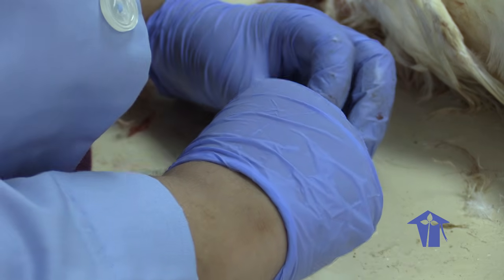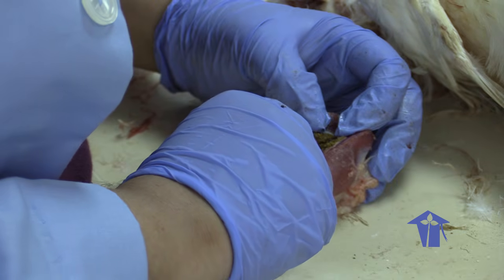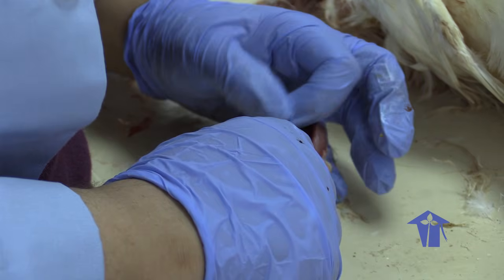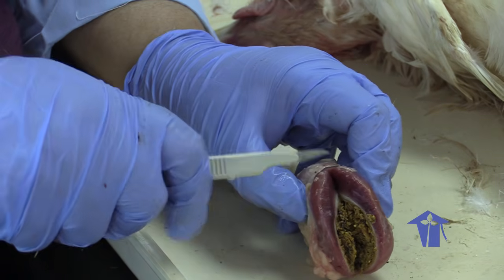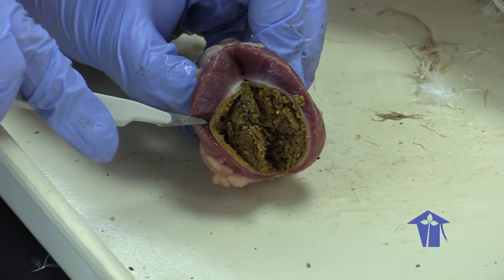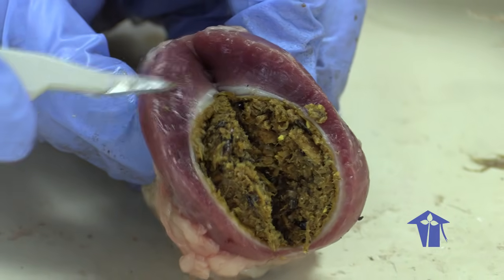And again, because my brothers love liver and gizzard, I would go through this in preparing their food. Okay. So, we've cut this open. Look at how thick this muscle wall is. And this material here in the middle, that's the food material that has been ground up by the thick muscular wall of this gizzard. So let's do this without me slicing a finger open.